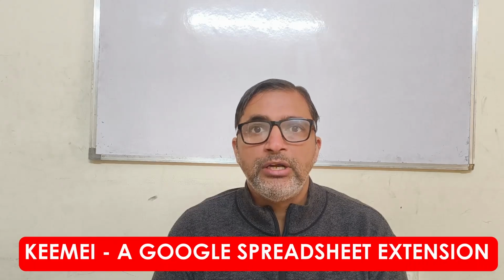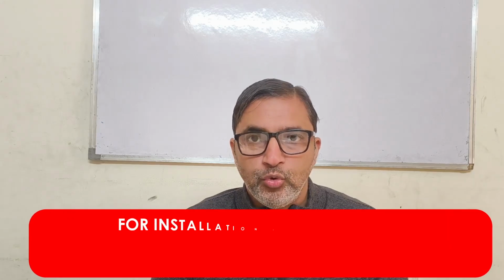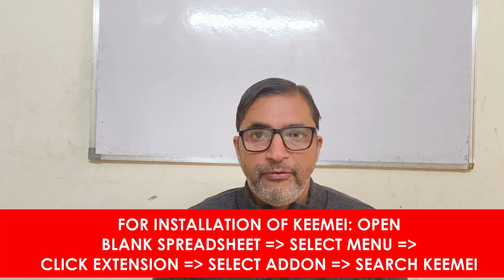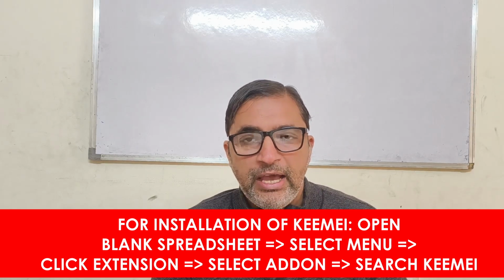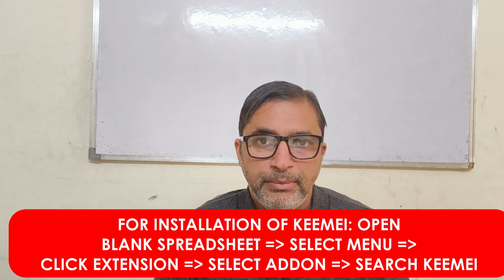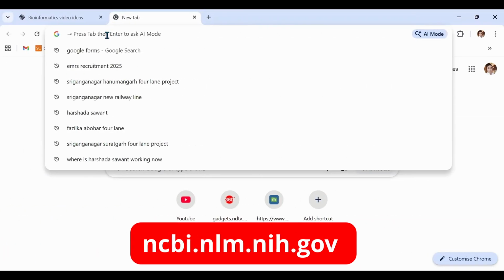Before moving forward, I would like to let you know that KEEMEI is not a command line tool, but rather a Google Sheets add-on. To use this tool, you need to open a blank spreadsheet and click on the menu button. From there, you will find the option of extensions. When you click on this extensions button, click on add-ons, and then you can search for KEEMEI. When you see the option, just press enter and you will be able to install the KEEMEI extension tool.